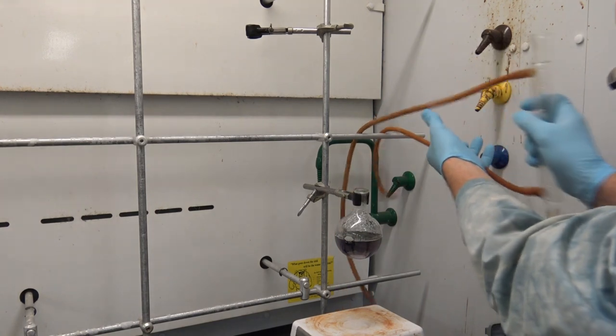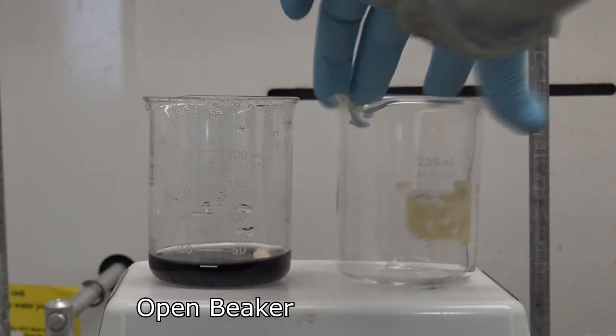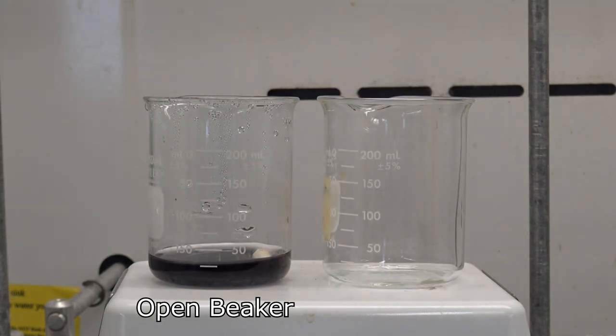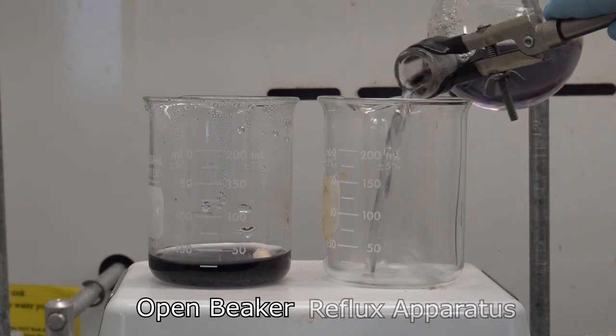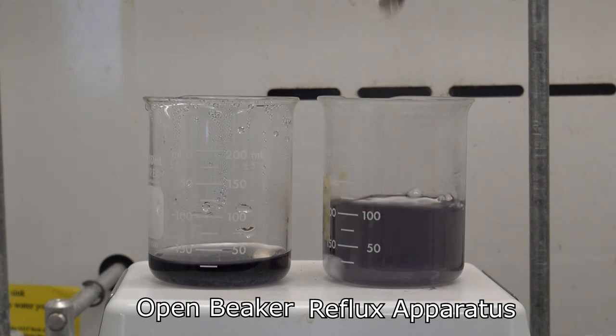Having done that, I'm ready to remove my condenser and both of my water lines, and place them elsewhere. Once my apparatus is completely deconstructed, I can now confirm that while I've lost significant volume in my open beaker, the solution that refluxed for a similar period of time has lost practically no volume whatsoever. This is the power of the reflux technique.